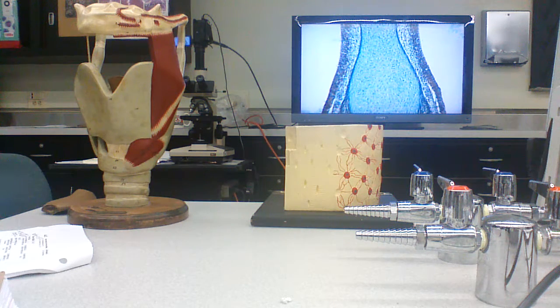Surrounding the middle of the cartilage, you're going to have a bony collar, with cartilage on the top and the bottom. Right? And inside of the bone, the cartilage cells are going to be stratified.